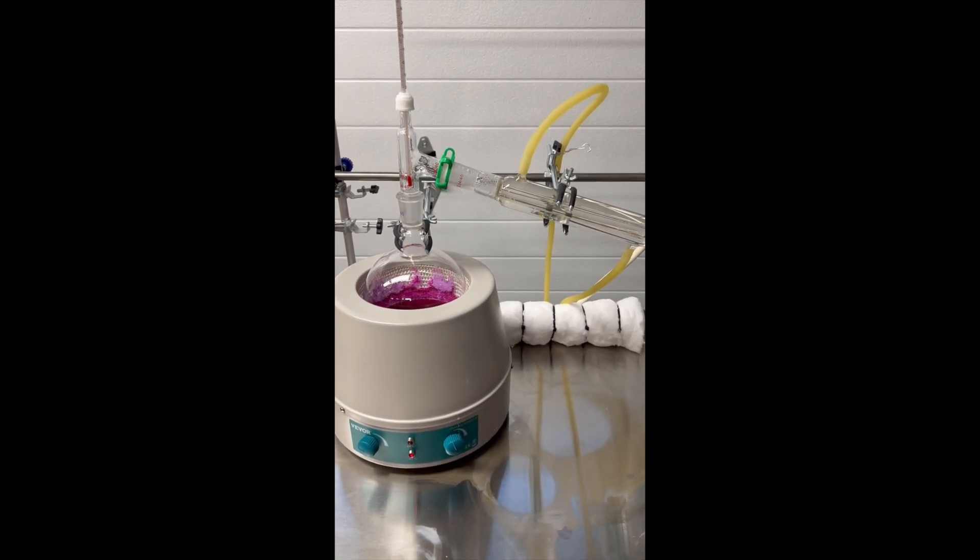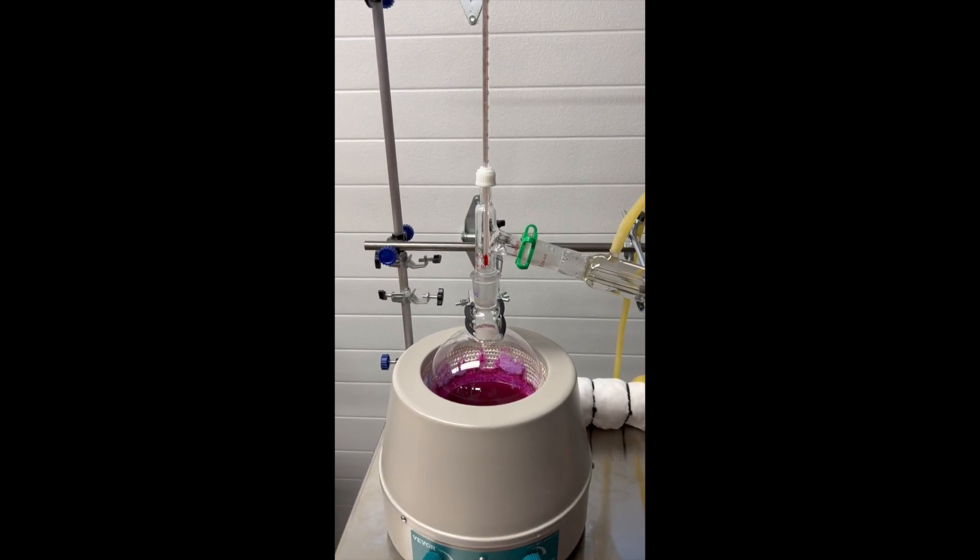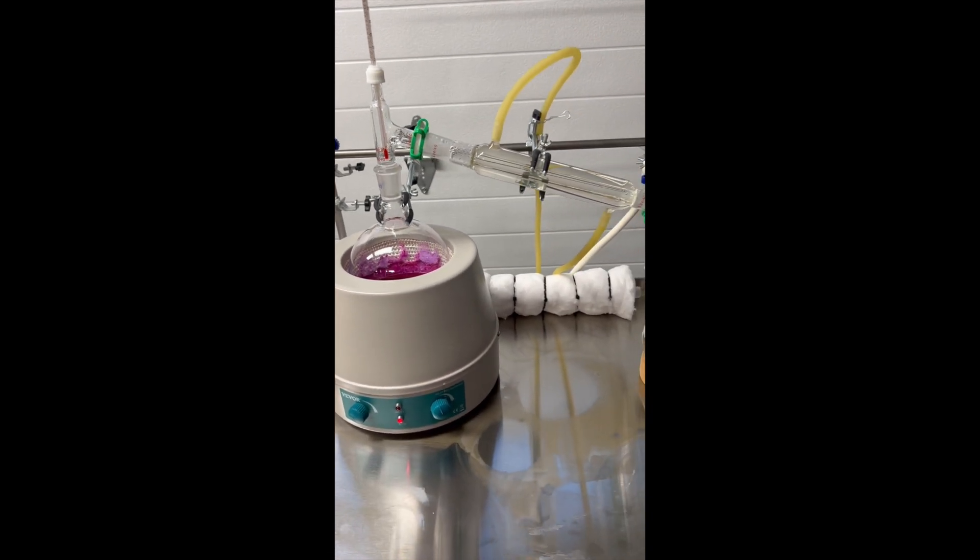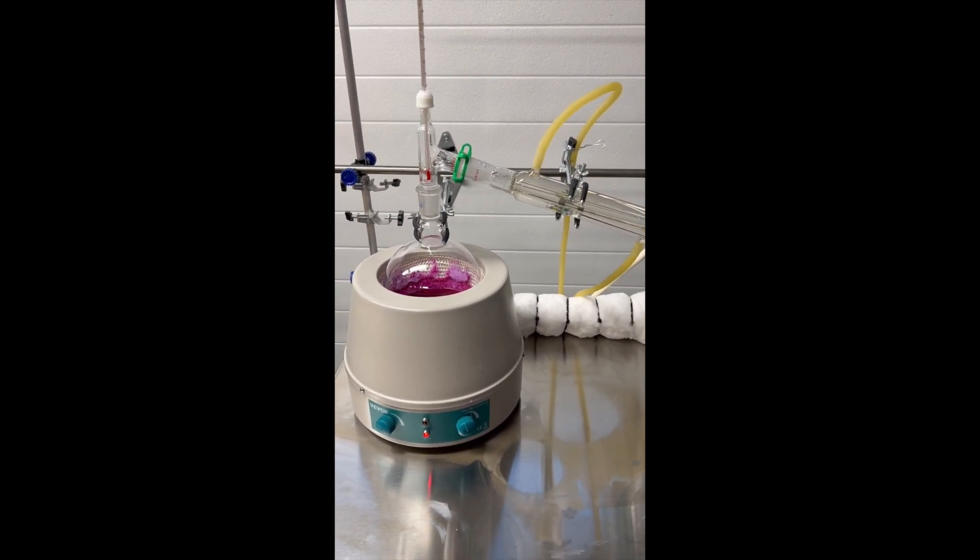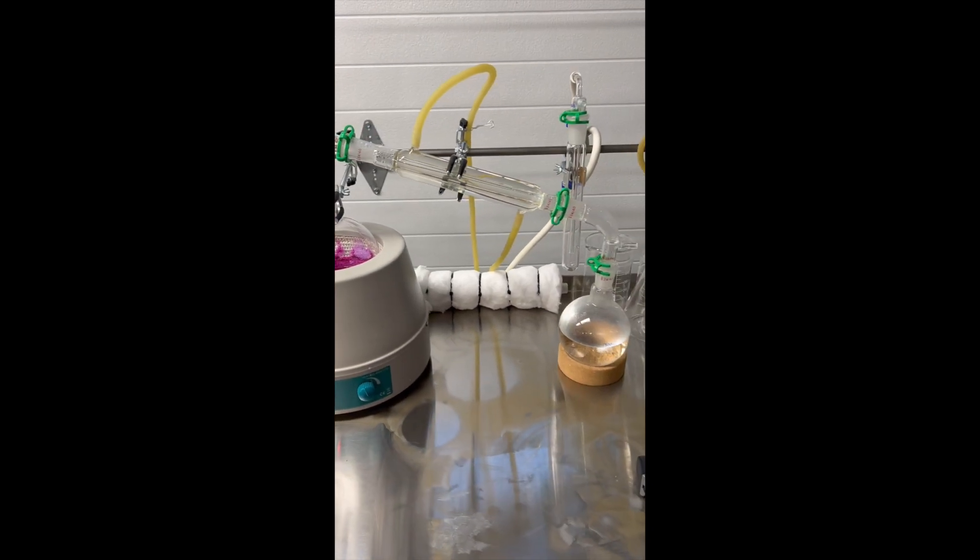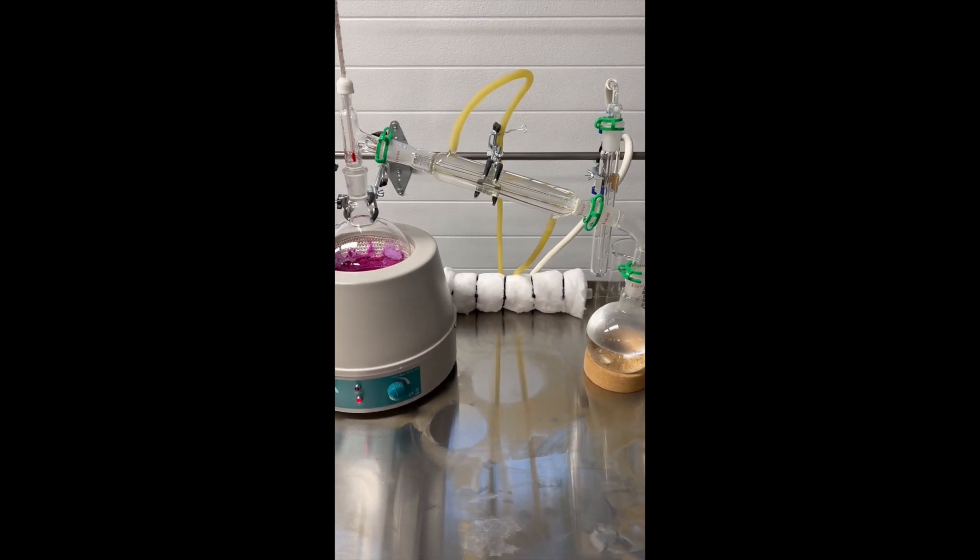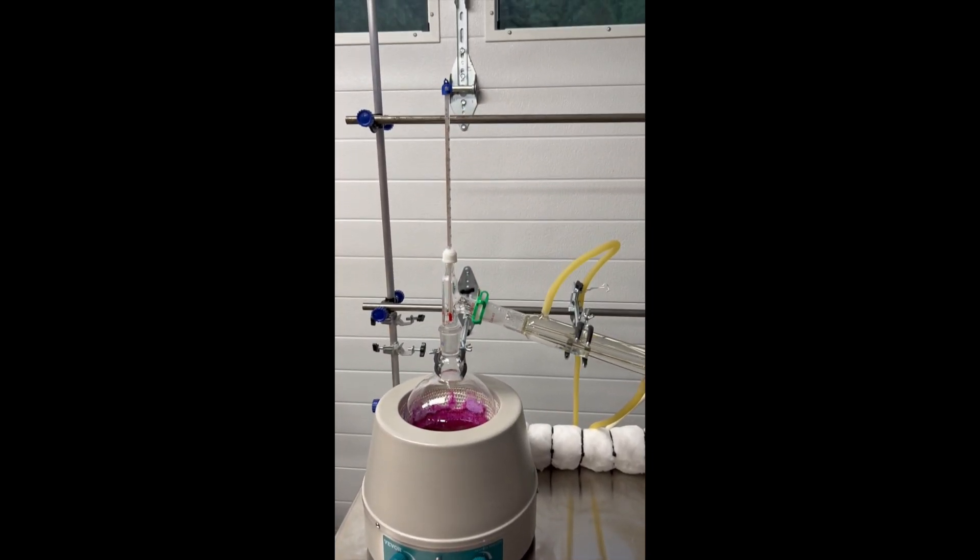Initially, there was 98 Celsius, 104, and then it jumped up to the 112. So 98 is probably just the regular water. The 104 could possibly be the deuterium since it is four degrees over regular water. And then once it went up to the 112, I stopped it.